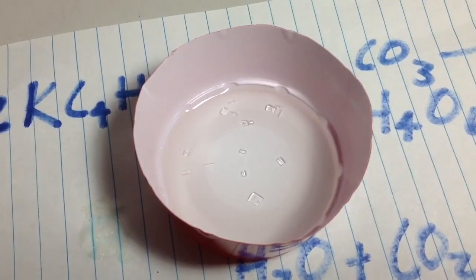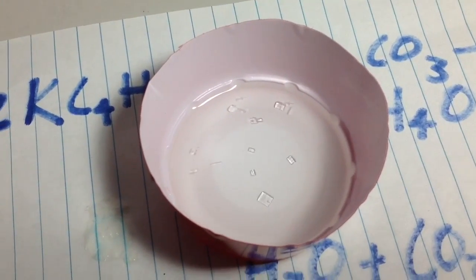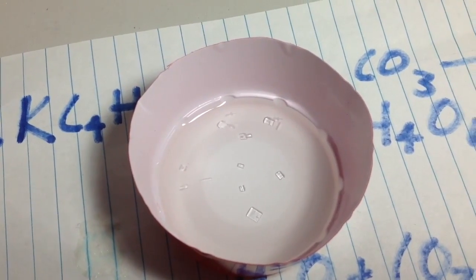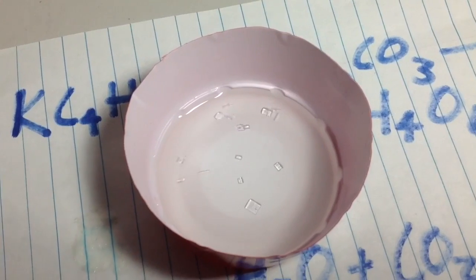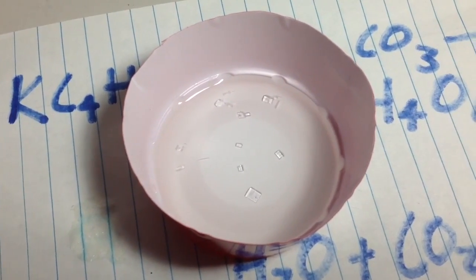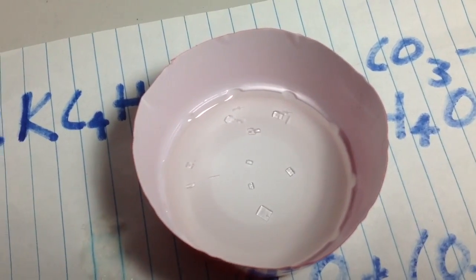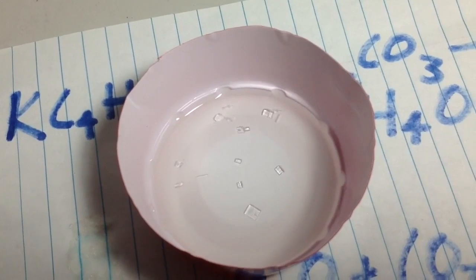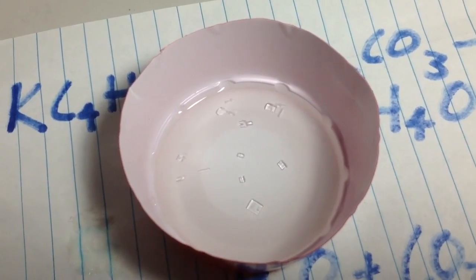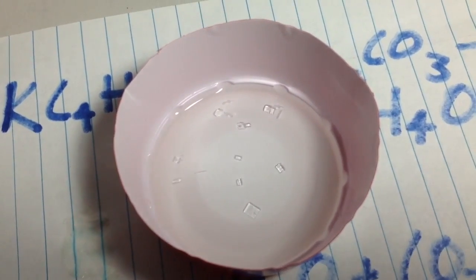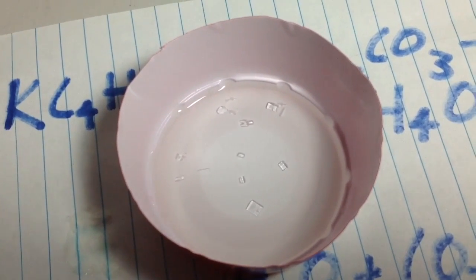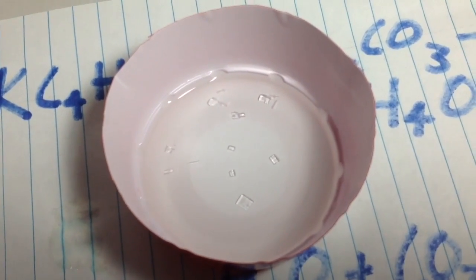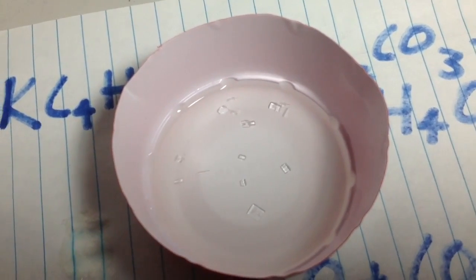It's been about four days and you can see that there are some small crystals of Rochelle salt growing. It's interesting to note that in the beginning, due to the amount of cream of tartar we used to prepare the solution, this solution should have been already supersaturated, meaning that it already holds more solute than it could contain, and that solute in this case is Rochelle salt. Theoretically, that Rochelle salt should have crystallized at the beginning. However, it did not crystallize until four days later, and it also rapidly crystallized. In fact, this morning I checked it and there were no crystals at all, and here I am in the afternoon, and suddenly these crystals spring out of nowhere. The reason for this is that the solution takes a long time to nucleate, which means to form tiny starter crystals from the solution. After these starter crystals are formed, the crystals can grow much faster because these starter crystals provide a surface area for the solution to deposit more solute on.